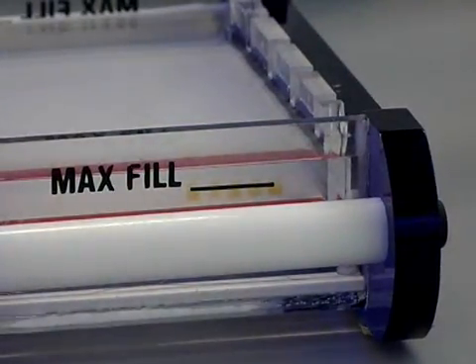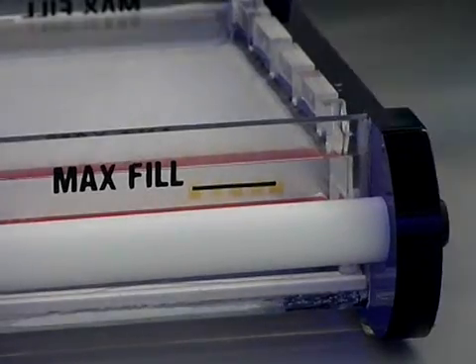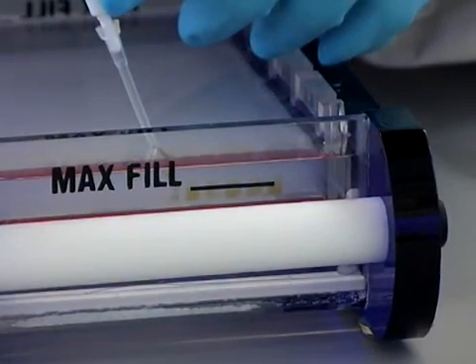The sample settles at the bottom of each well, ensuring that the DNA travels through the gel and not across the top of the gel.